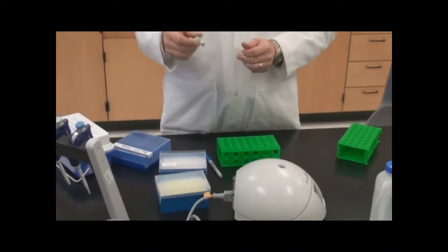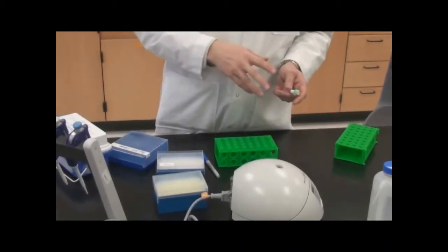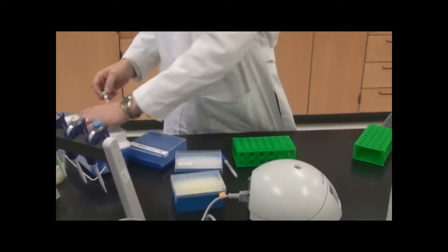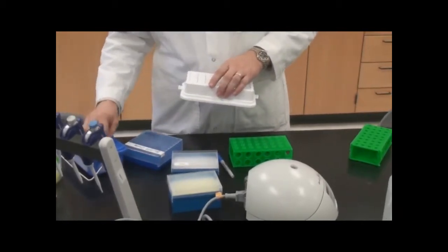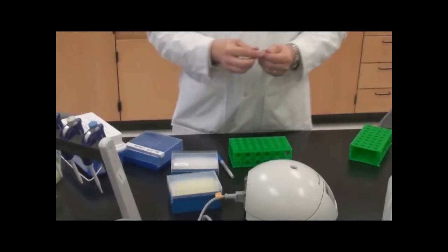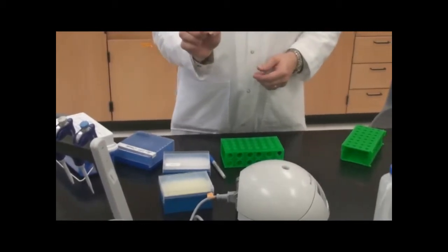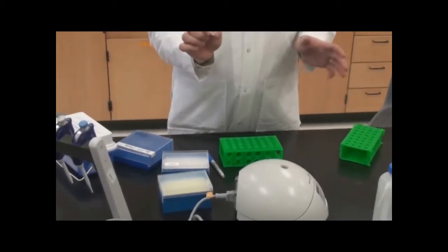If we were to take this sample and use it for all of you, one person would thaw it, another would freeze it, thaw it, freeze it, and that would be bad for the ATP. So instead what we're going to do is aliquot. Your teacher will aliquot the ligation buffer into these smaller tubes.